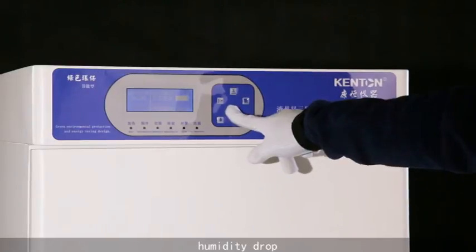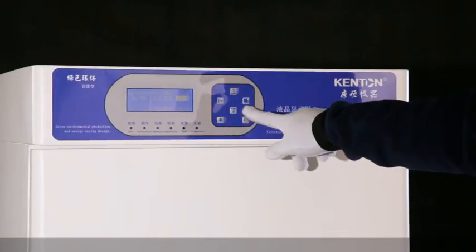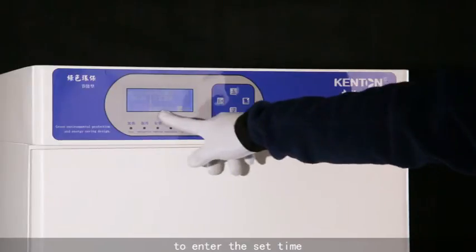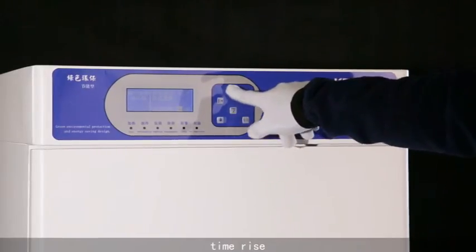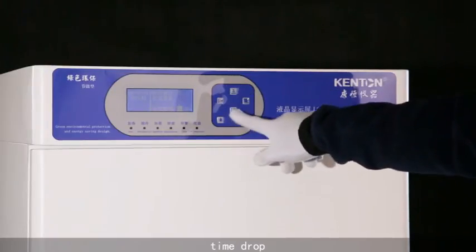Then press the set button to enter the set time. Time rise, time drop.